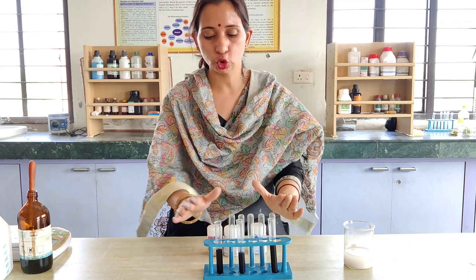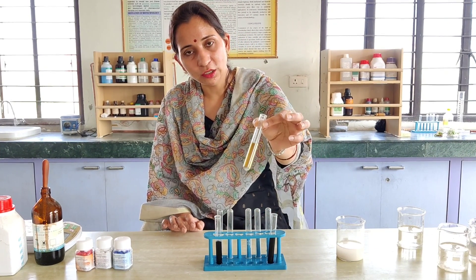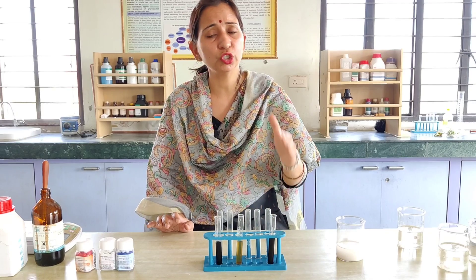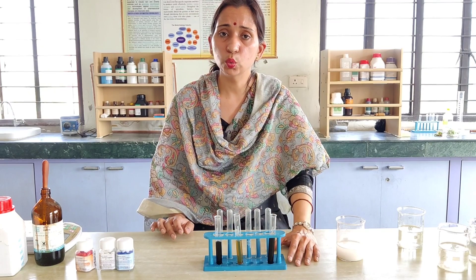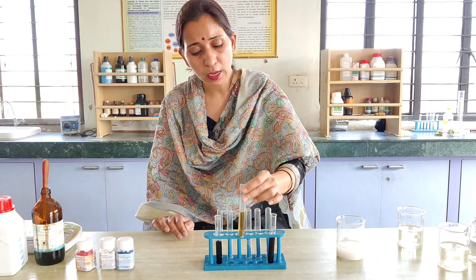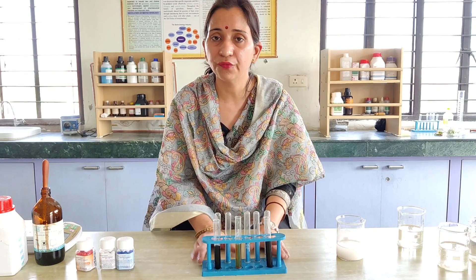After adding salivary amylase to each test tube, we observe the activity. In the test tube with pH 7 (neutral pH), the color change is visible, as salivary amylase works maximally at pH 6.8, which is very close to pH 7. The salivary amylase breaks down the starch and the blue-black color produced by iodine disappears. This demonstrates the activity of salivary amylase at different pH levels.